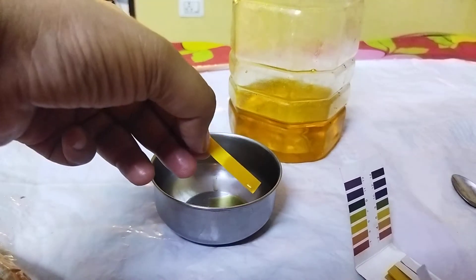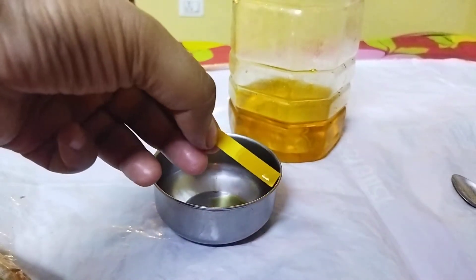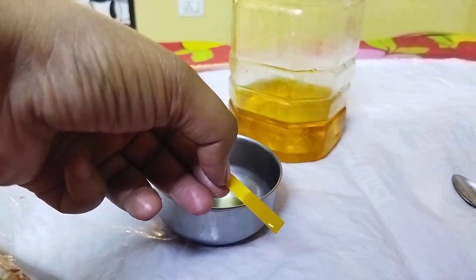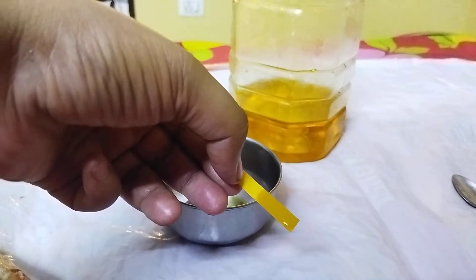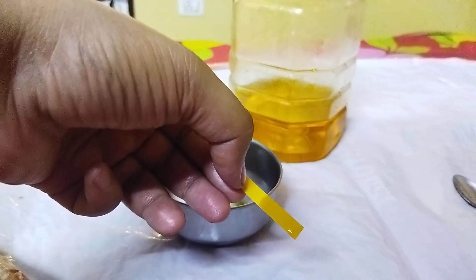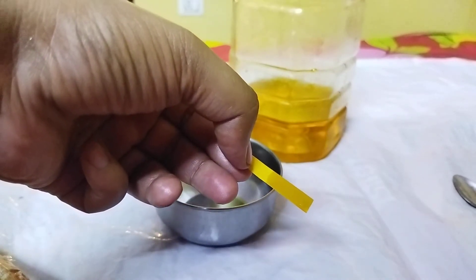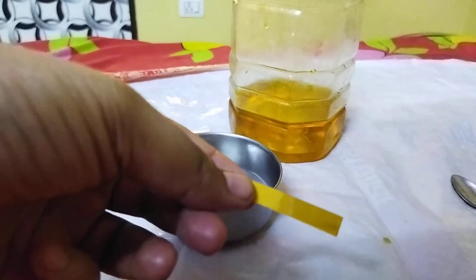So I'm just going to pause this video and we will wait for it to dry. I know it's a lubricant so it won't be getting dried out completely, but still we'll wait for one or two minutes so that we can have better results. I'll see you after some time.